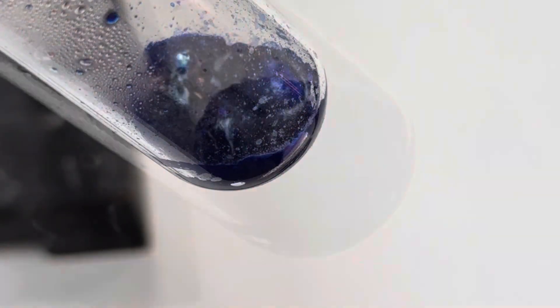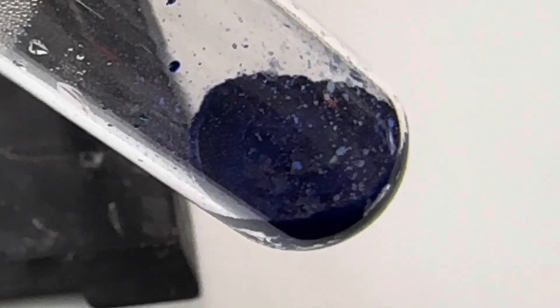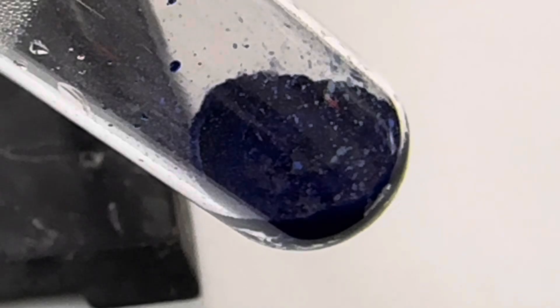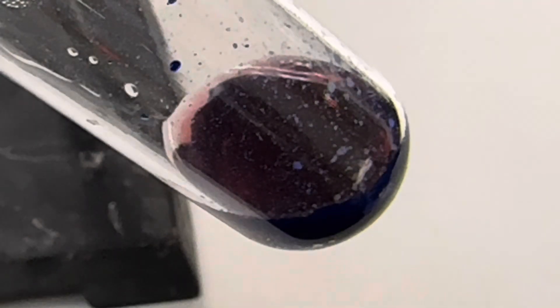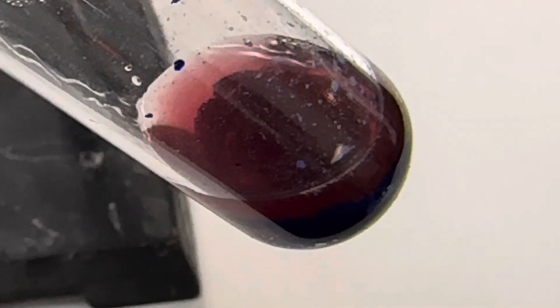Remove your heat. At this point, you have anhydrous cobalt-2-chloride, and when we add water, we can reverse the reaction and go from that deep blue color to a more red-pink color. You'll start to see a change from blue back into that pink color as you reverse the reaction.